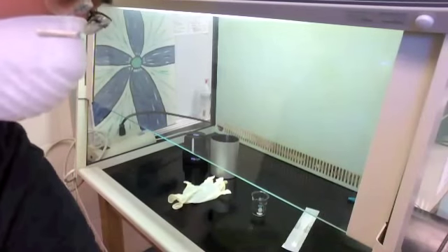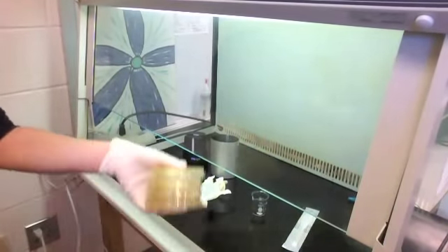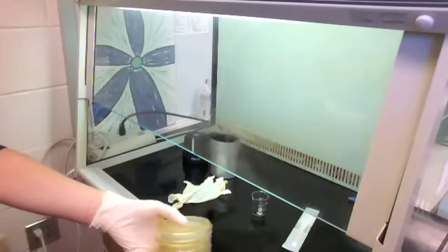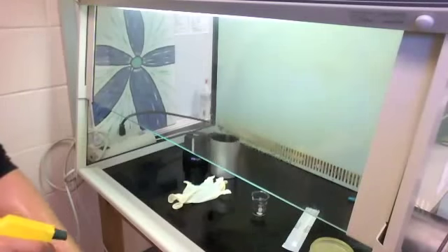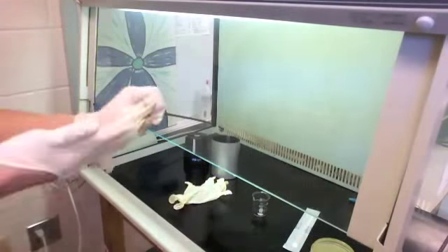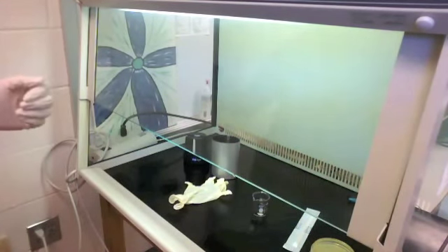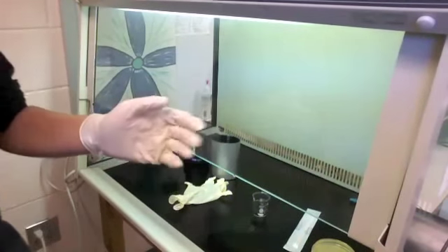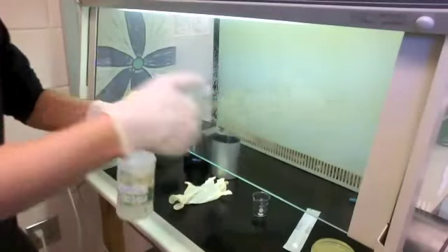Now that I finally got my glove on, I'm taking these petri dishes and spraying them with ethyl alcohol — all those puffs and wisps are the ethyl alcohol. You can see I'm spraying myself as I put my hand inside. Now I'm slipping on my other glove and going to respray both arms up to the forearm and elbow.